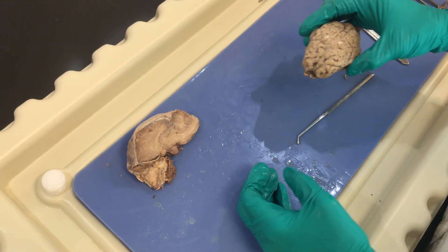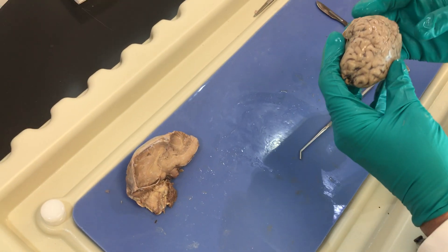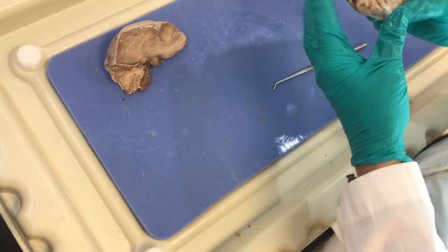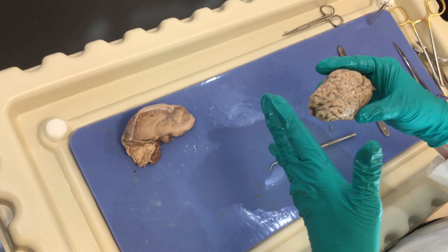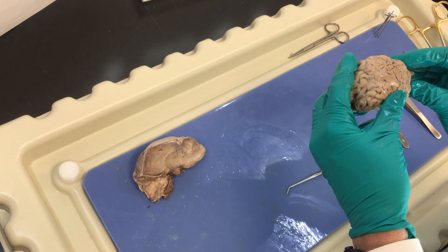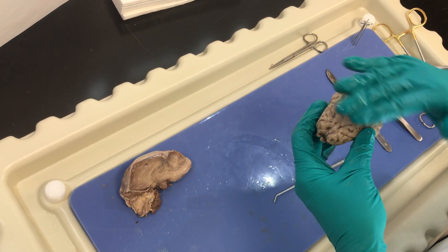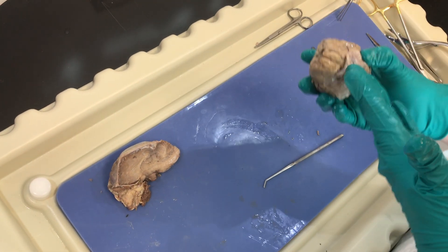Hello, today we're gonna be dissecting a sheep brain. As with all our dissections, it's important to orient yourself. This is the anterior or cranial aspect of the sheep brain. This is the caudal aspect, or what we would call in humans the posterior aspect. This is the dorsal aspect and this is the ventral aspect.